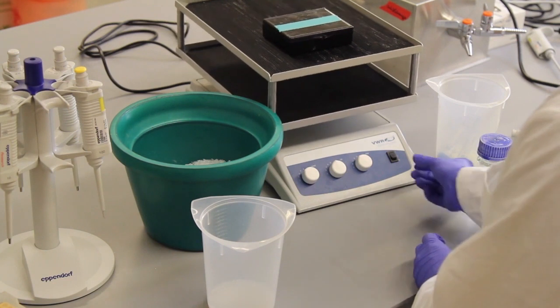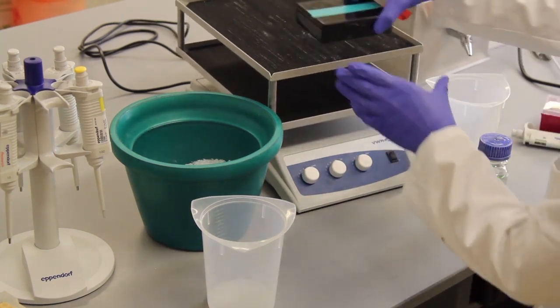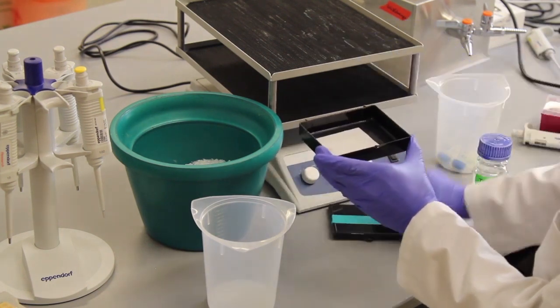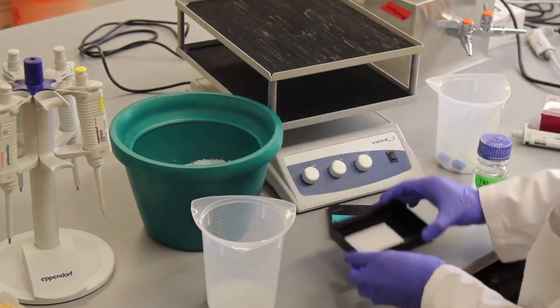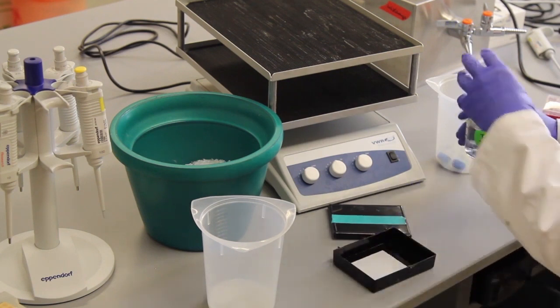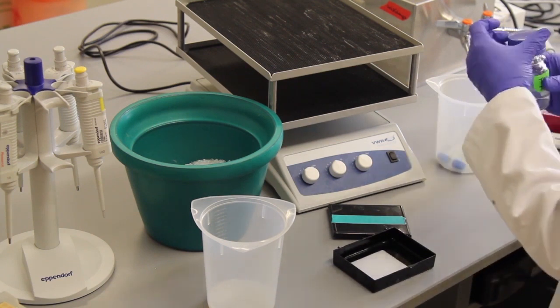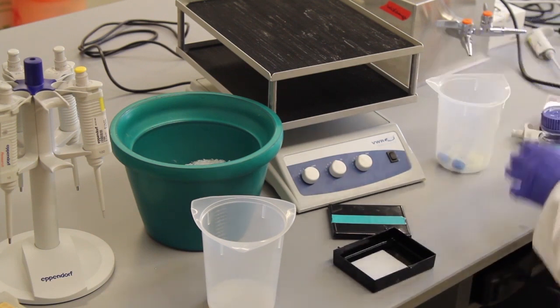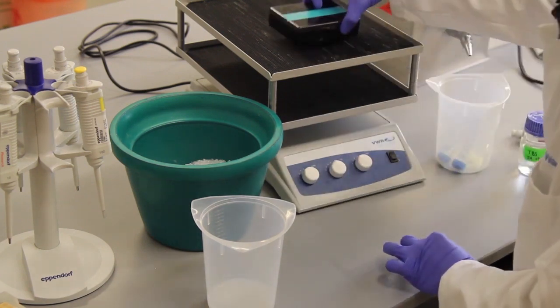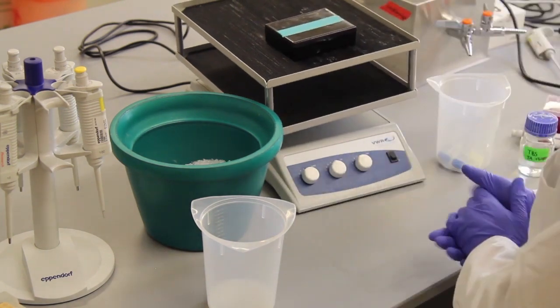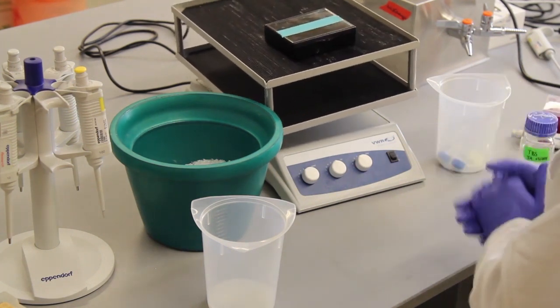The secondary antibody has now been sitting on here for one hour, which means it is also done. Dump off the antibody. And just like after the primary antibody, there will be three wash steps here. Again, I cover the membrane in enough TBS-T to make sure all of it is covered. Close up the box. Place it on here. Turn it on. And again, this will happen for a total of three washes at five minutes each.